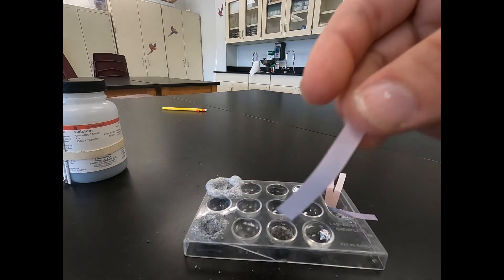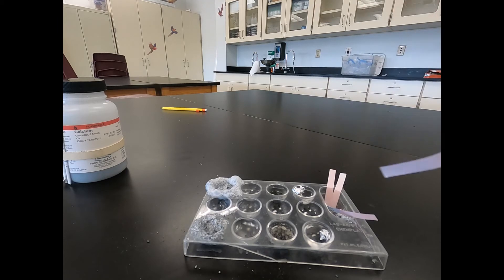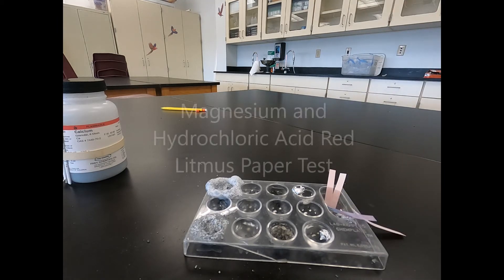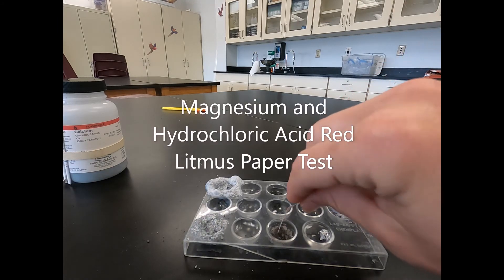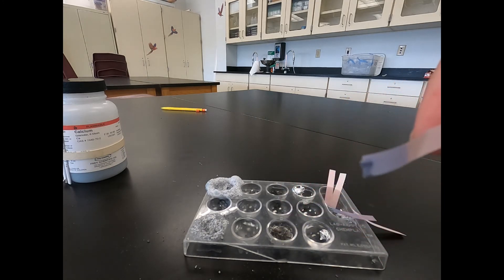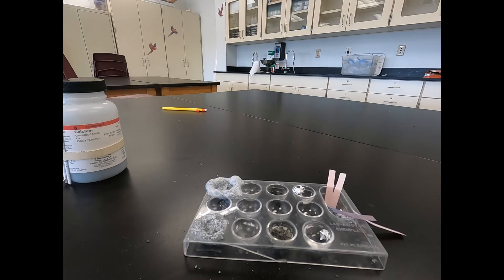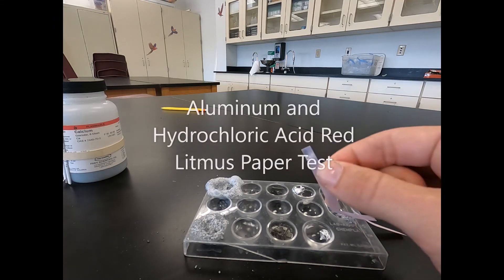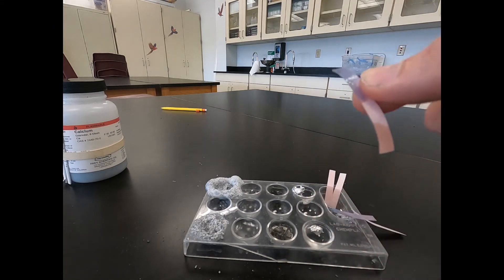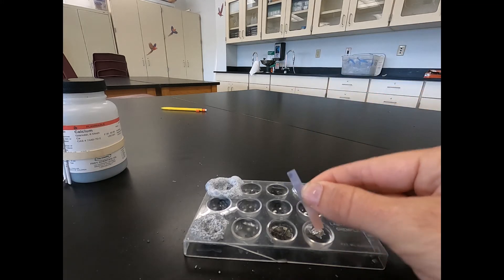And you can see we're starting to see a color change already. Then we'll do our magnesium next. And you can see that clear blue color change — I'll just flip this one over. And we're going to do our last one, our aluminum. And you can see it remains that red acid color.